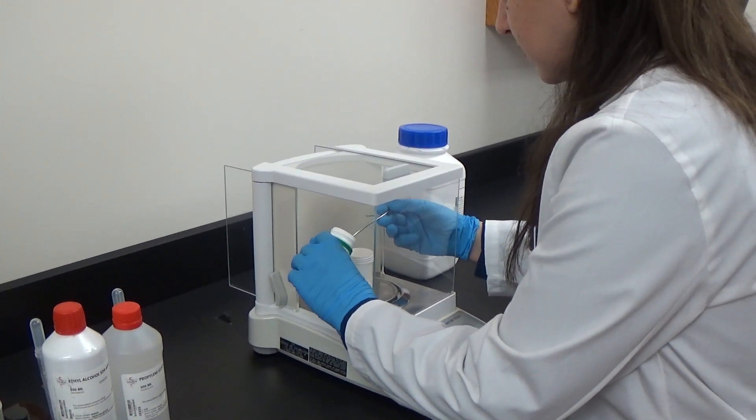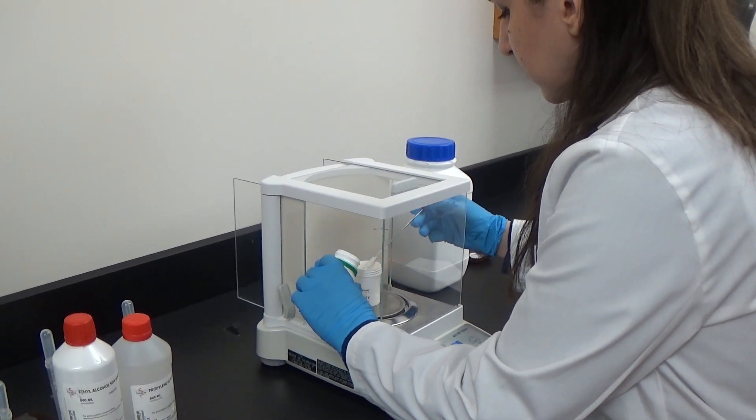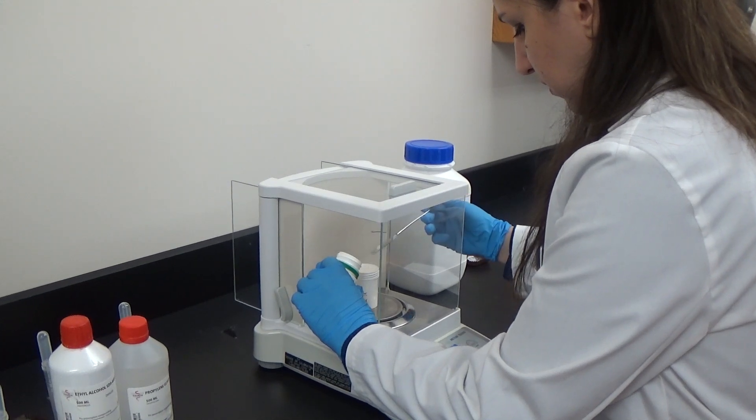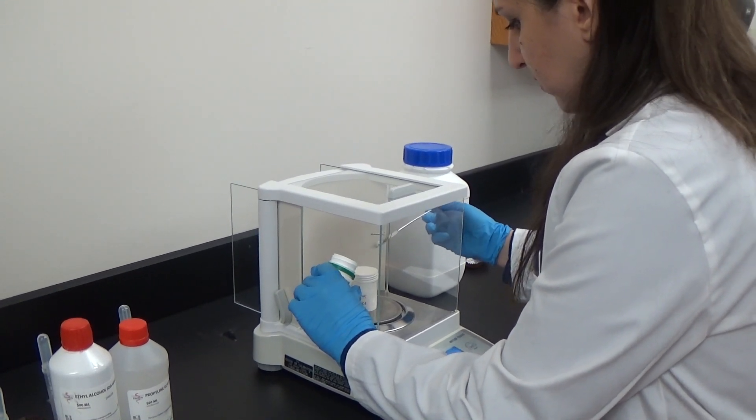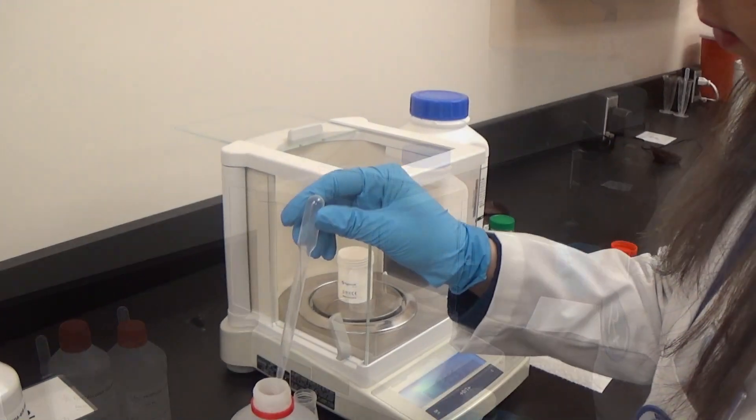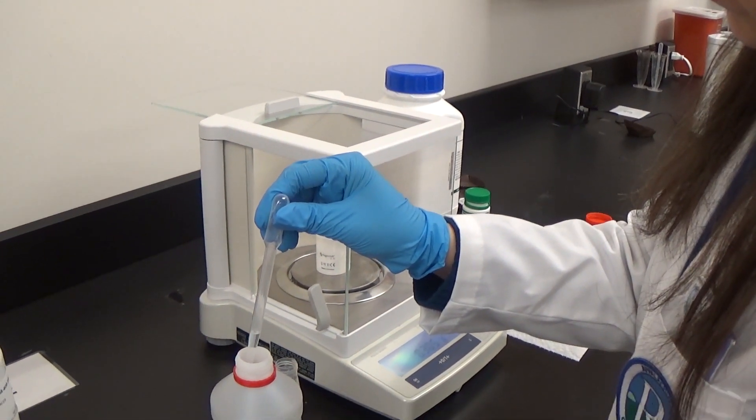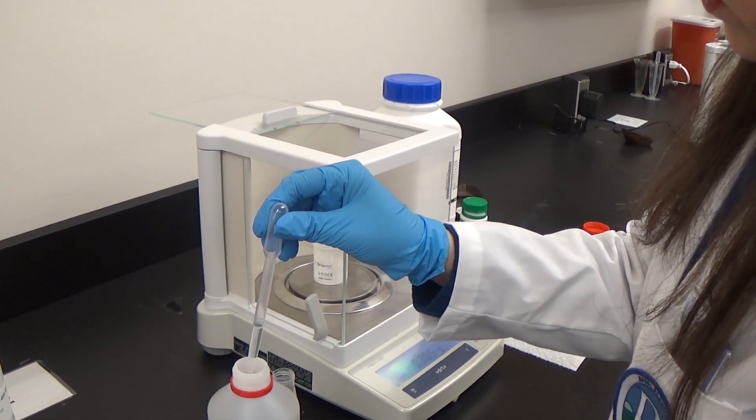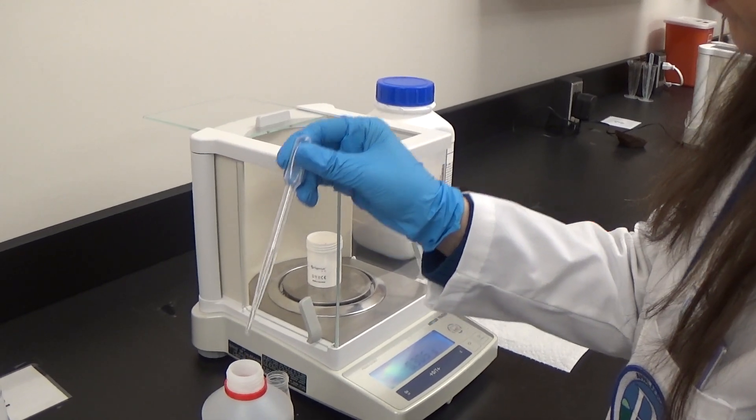Next, we'll weigh and transfer the lidocaine ingredient directly into the dispensing container. Next, we'll add propylene glycol using a pipette to the dispensing container.